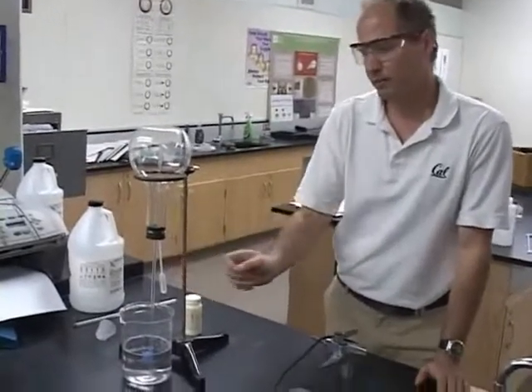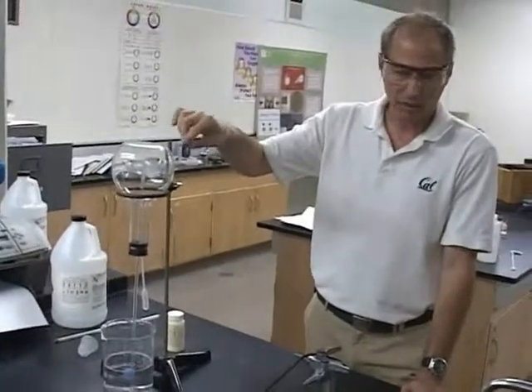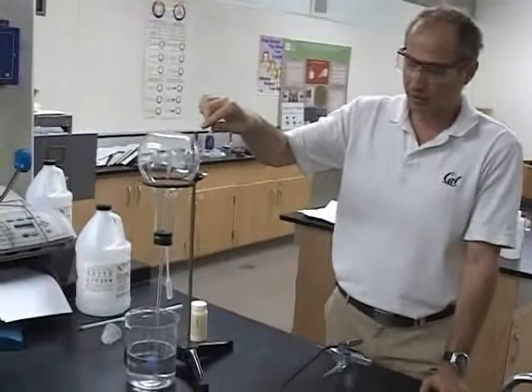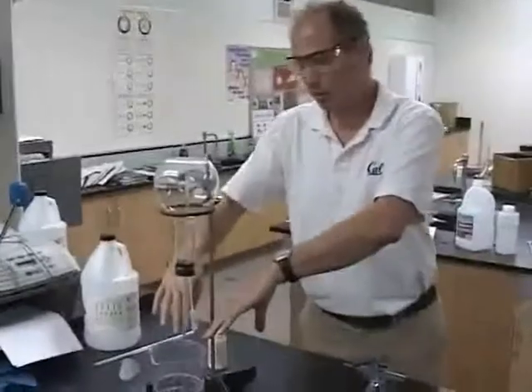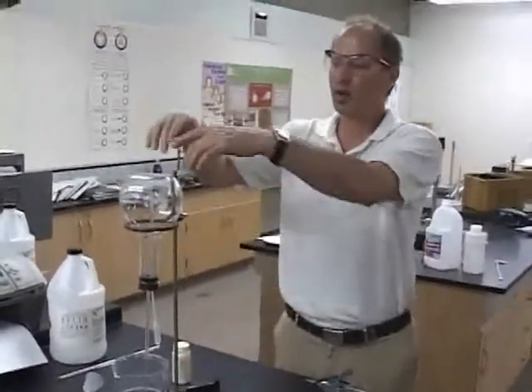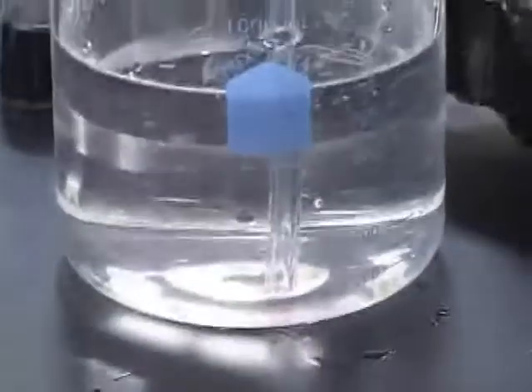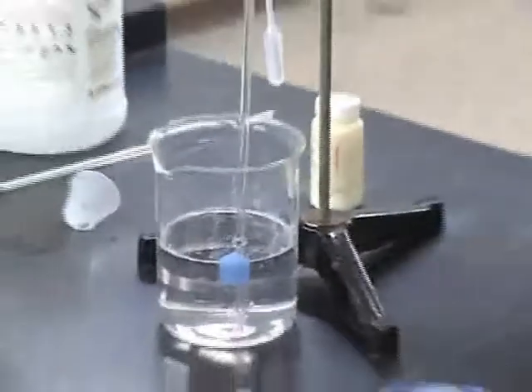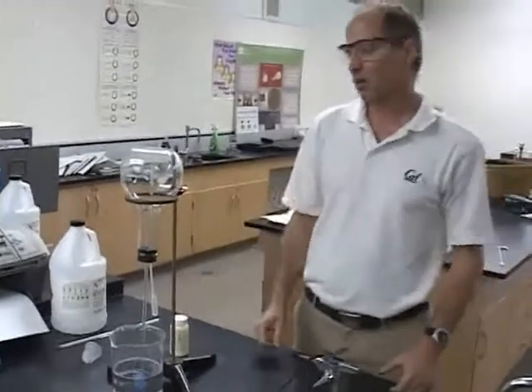I put water in. The ammonia gas is at normal atmospheric pressure. Where does the ammonia gas go — does it stay there or does it dissolve into the water? It dissolves into the water. And as the ammonia gas dissolves into the water, what happens to the pressure inside the flask? It drops. The atmospheric pressure pushing on the water outside hasn't changed. So the atmospheric pressure keeps pushing on the water — there's no pressure pushing over here. The air out here is pushing harder, so what do you predict is going to happen? The water's going to shoot up the little tube.